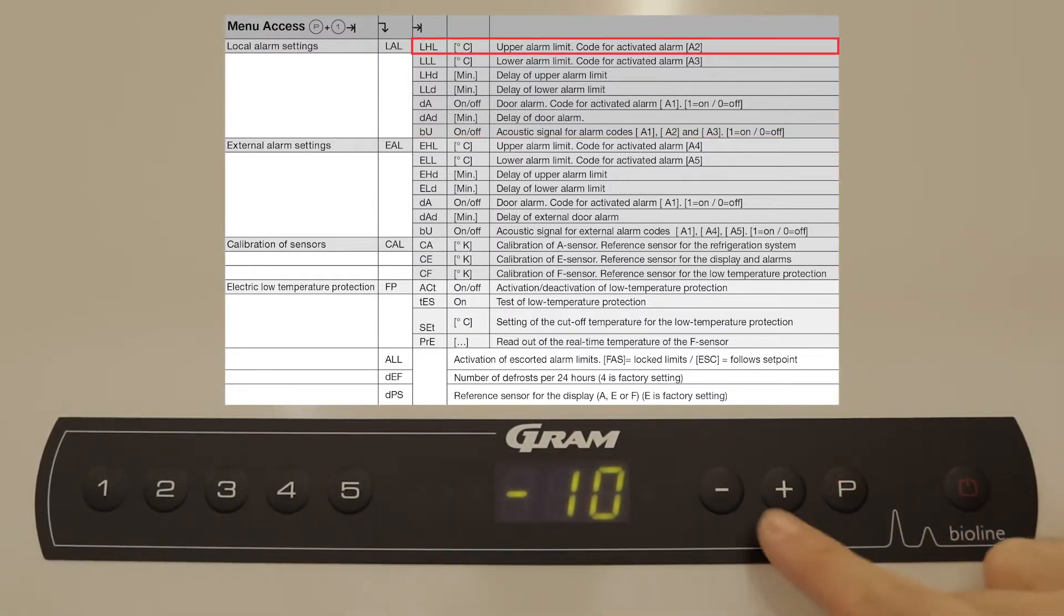Here we will set the temperature to minus 10 degrees Celsius. Press select and the power button to go back to the menu.